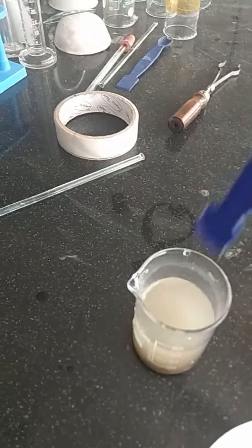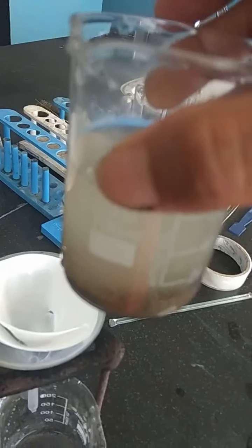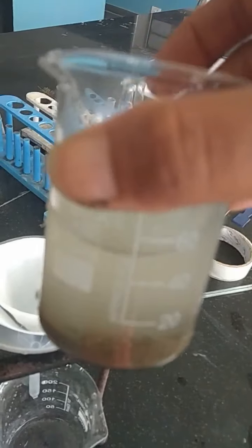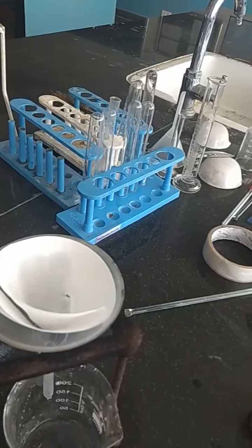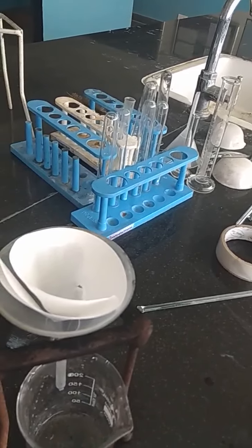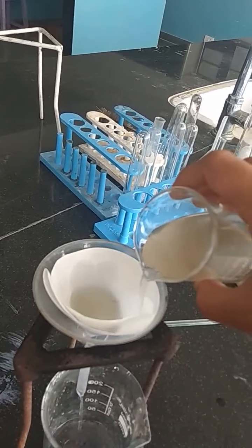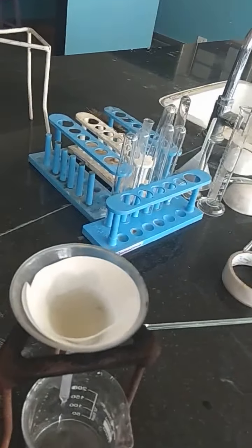You can see it over here. So we've used muddy water, and now I'm going to filter this muddy water. We could use a stirrer by taking it in hand, but now I'm using it directly. So what I'm going to do is pour this muddy water into the filter paper, and finally we are going to see the result, what happens. So now I'm pouring this muddy water into it.